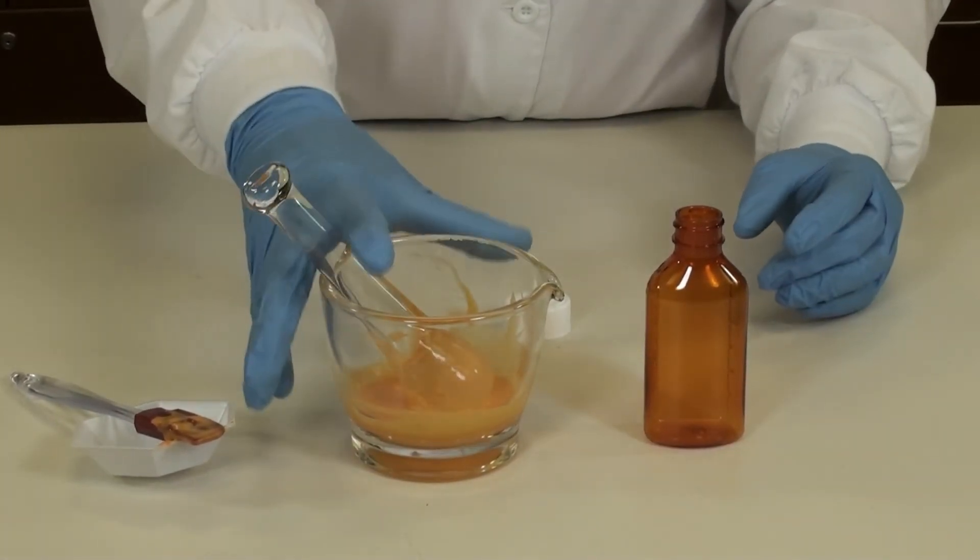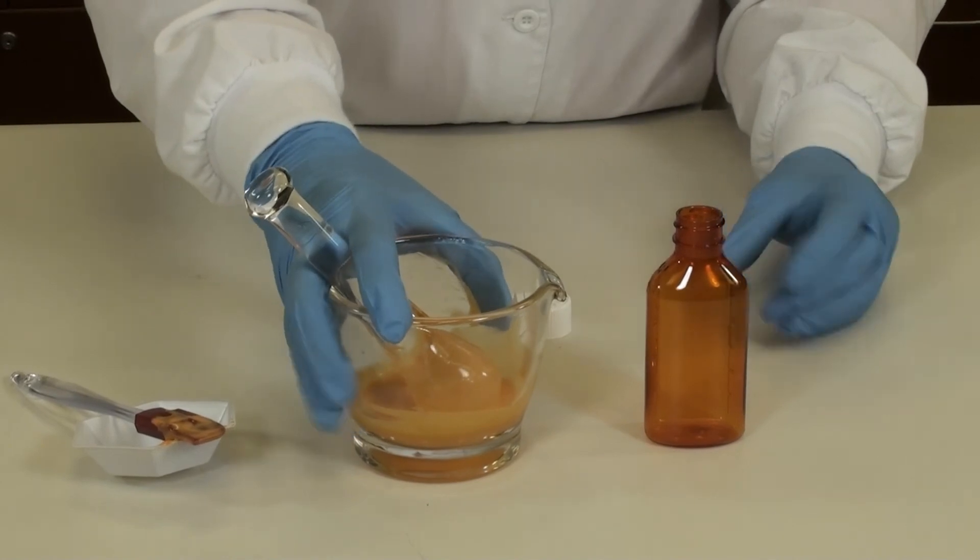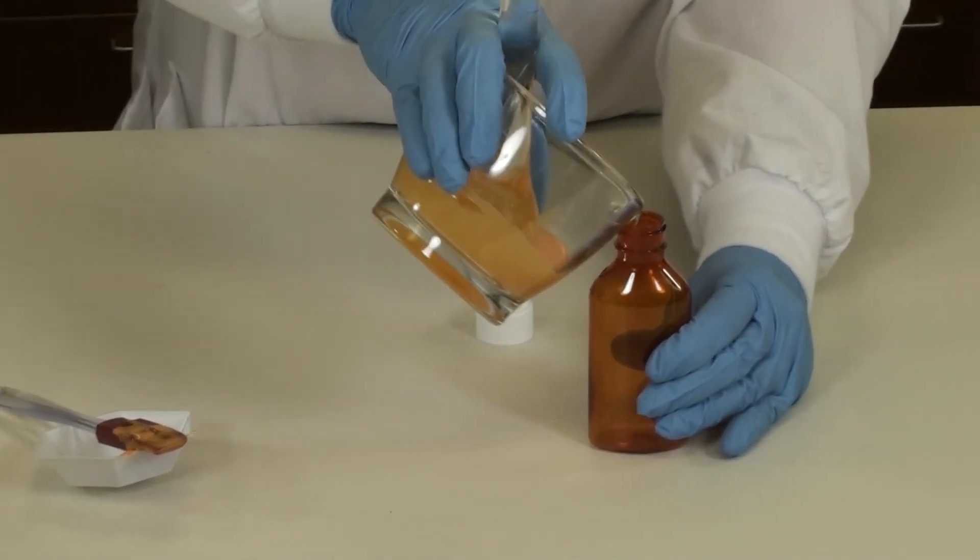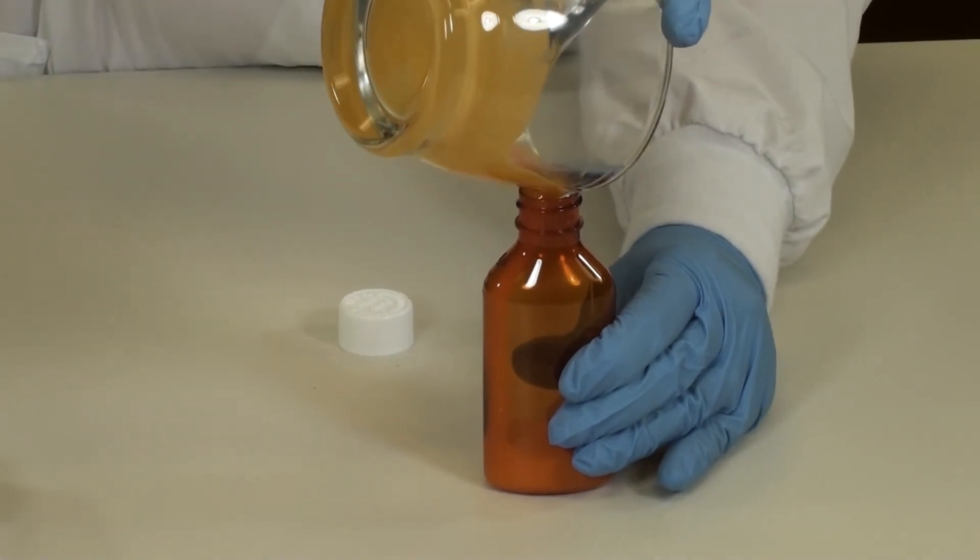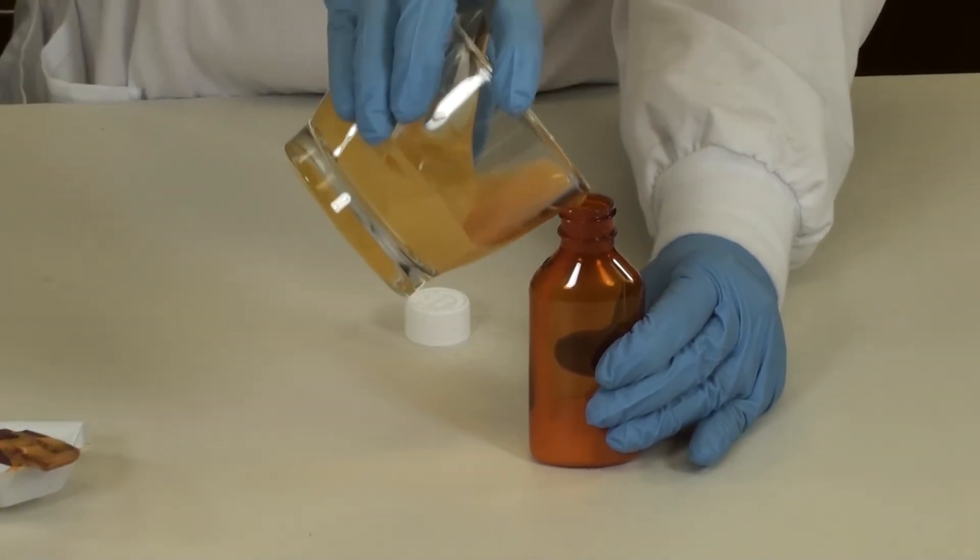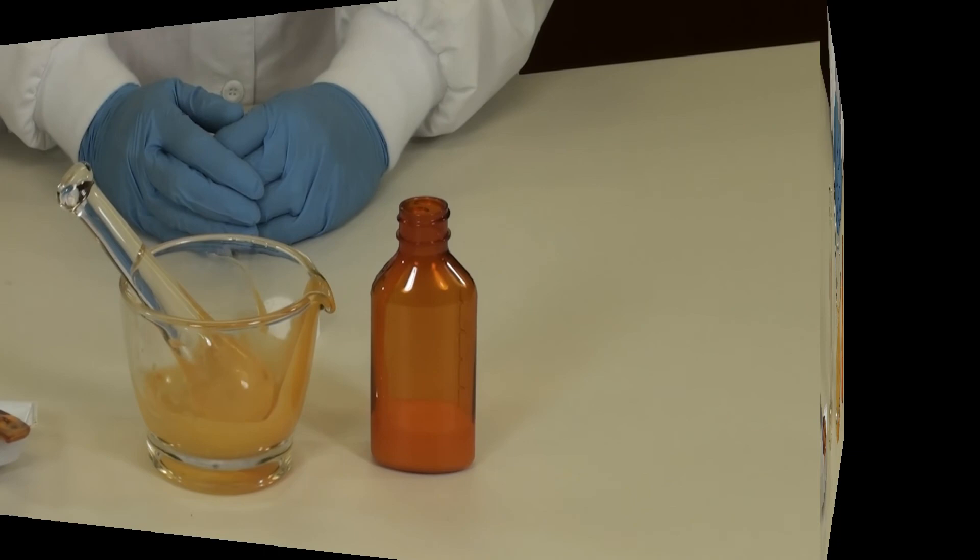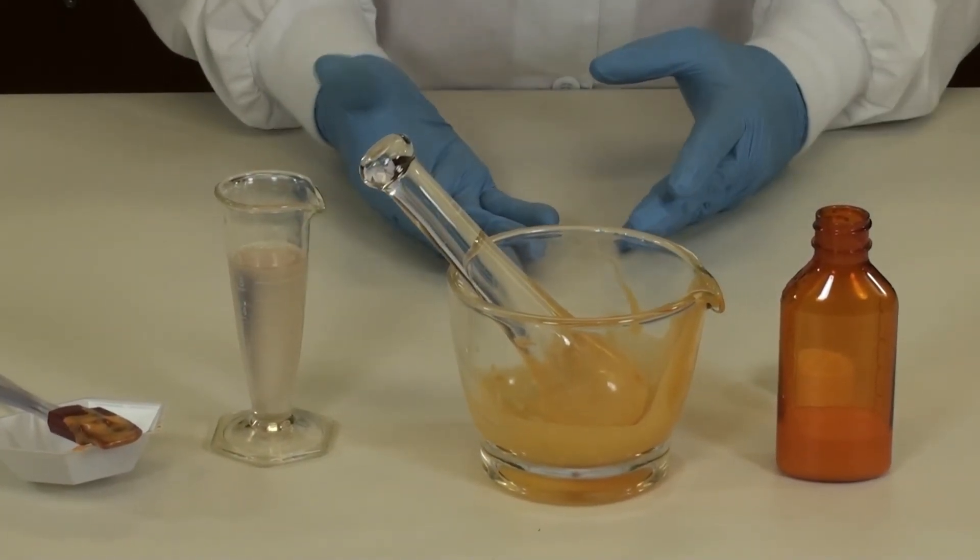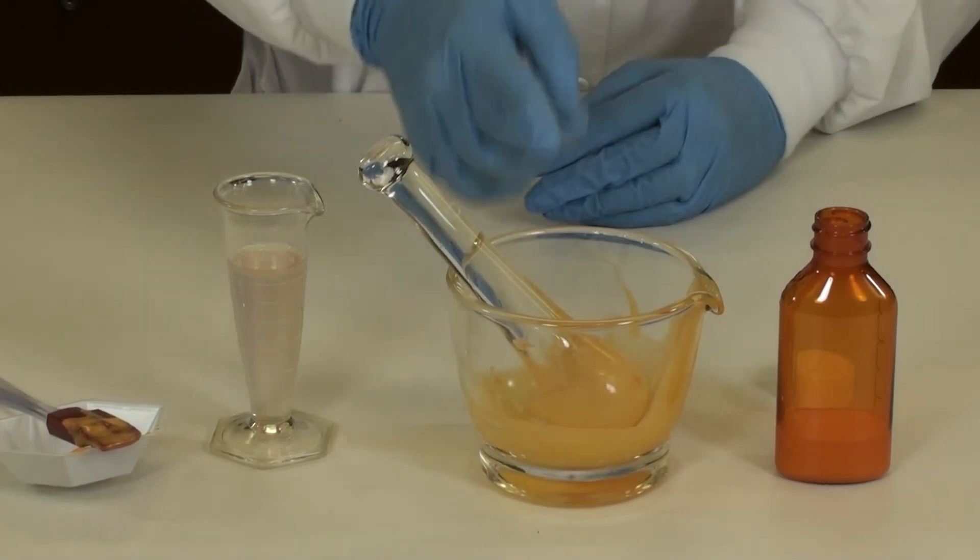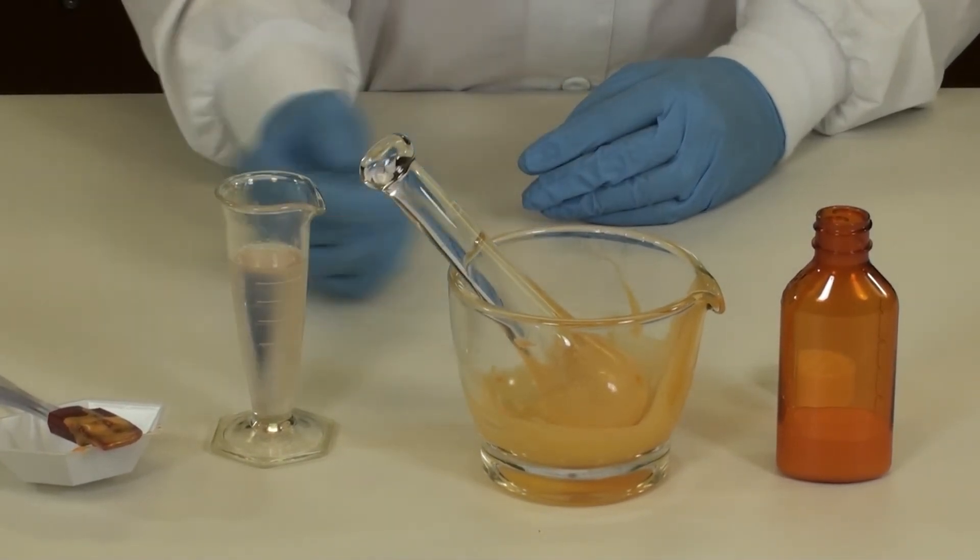You can hold the pestle with one finger while you pour the product. We're now ready to rinse the drug out of the mortar and rinse it off your pestle and also off your spatula.